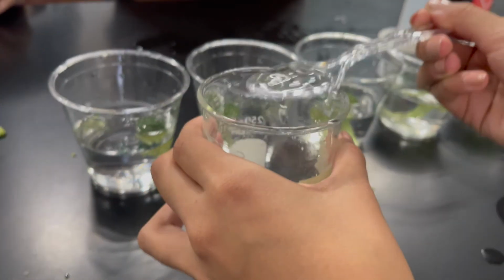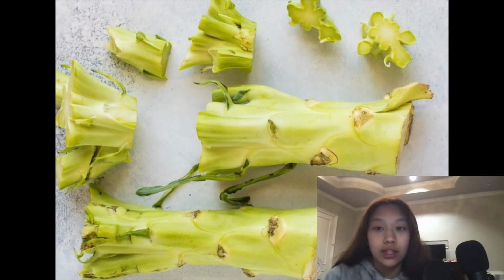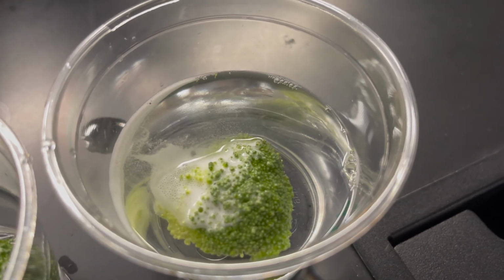This brings us to our future extensions. One future extension we would do is that we would exchange our teaspoon that we use from a plastic to a real teaspoon. This will make the amounts of H2O2 more consistent and make our results more accurate. We saw most of the reaction occur in the stems instead of the head. To elicit a better reaction, we would want to use the stems instead of the head and the stems.